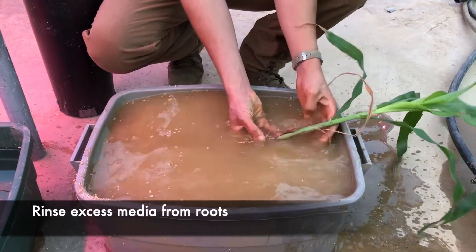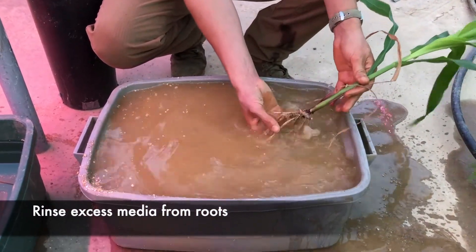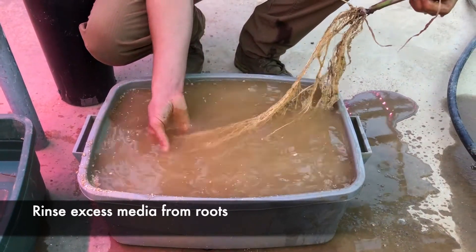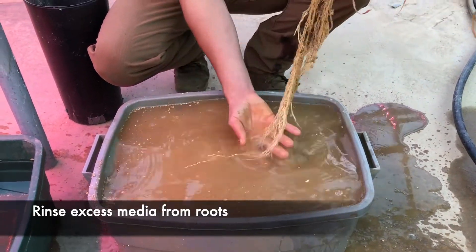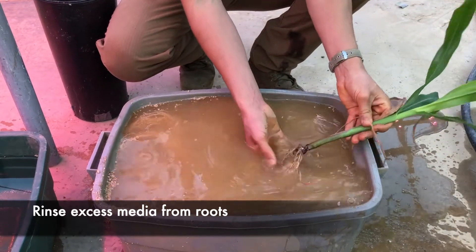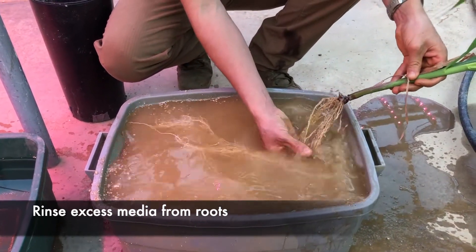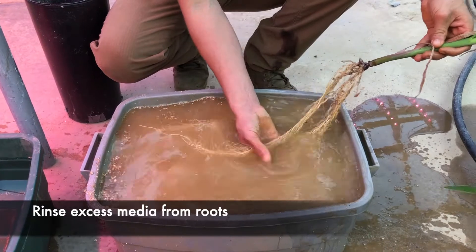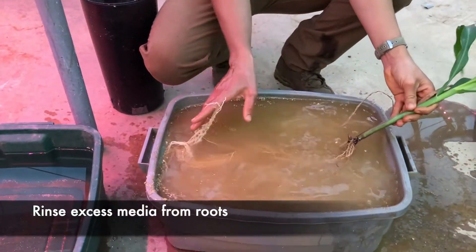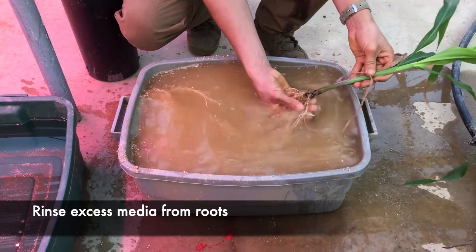To remove additional media from the root system, we rinse the roots in water kept at ambient temperature. Be mindful that temperature will have a strong effect on the respiration rate, so it is important to ensure that roots are not washed in cold or hot water prior to the measurement. Similarly, the sample chamber should not be kept in an artificially hot or cold environment relative to the temperature of the intact root system in the pots.